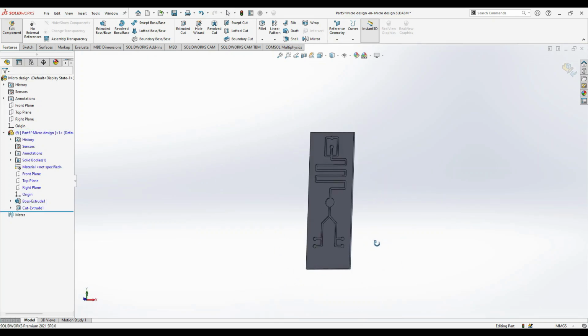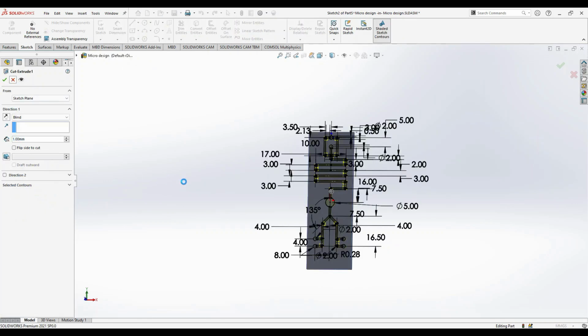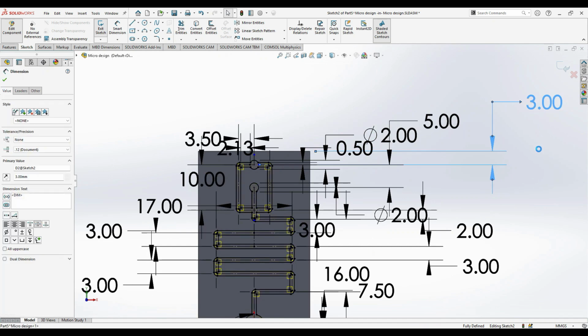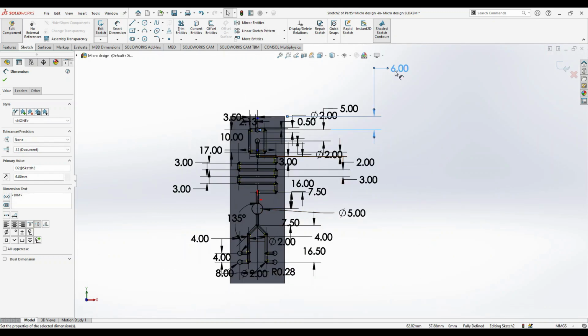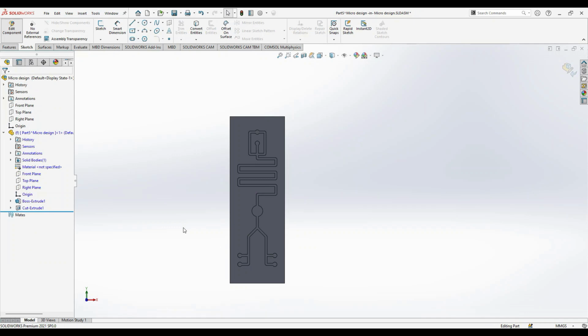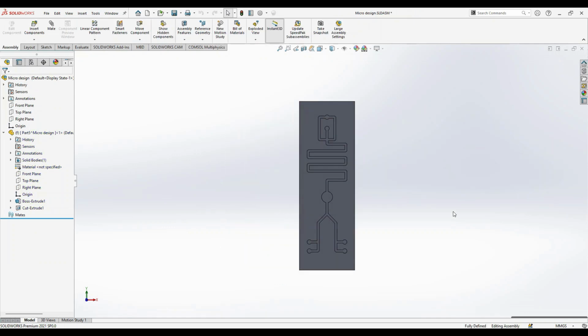Now after that, as you see, the length of the substrate is 75, but it is more. So what we do is just go back to the sketch, and remember, starting we have given a length of 3 mm just to make it constant. So we can increase this length to 6 mm, so that the complete device design is shifted down, and I think we can further increase it. Okay, so overall it looks symmetric.